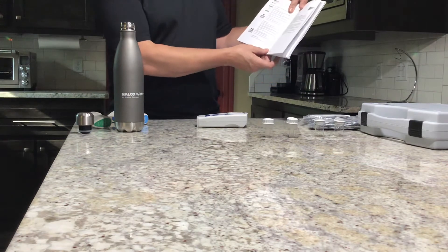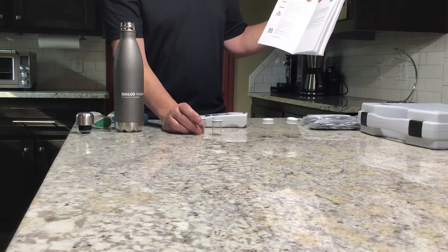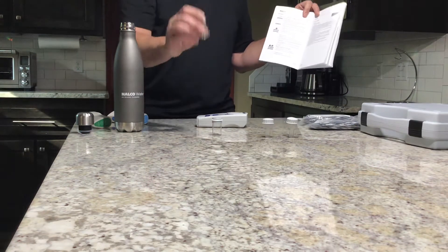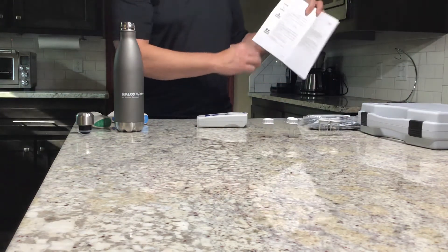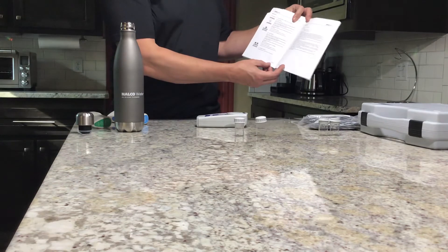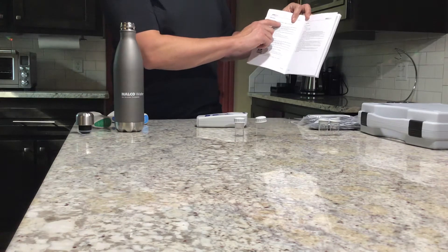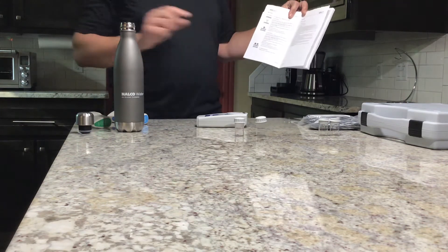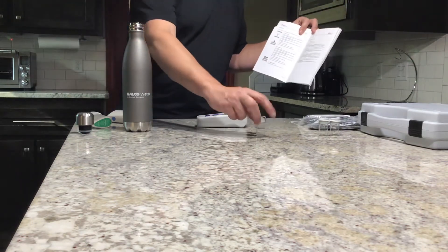On page eight, taking a sample with the glass sample vials covers a chlorine range of 0.02 to 2.0 milligrams per liter or parts per million — that would be considered the low range. If we flip to the next page, the plastic 5 milliliter vials are used and the range is quite a bit higher: 0.0 to 8.0 milligrams per liter or parts per million. Those terms can be used interchangeably. In this case we've got a domestic cold water sample and I already know the range is quite high, so we're going to be using the high range sample.